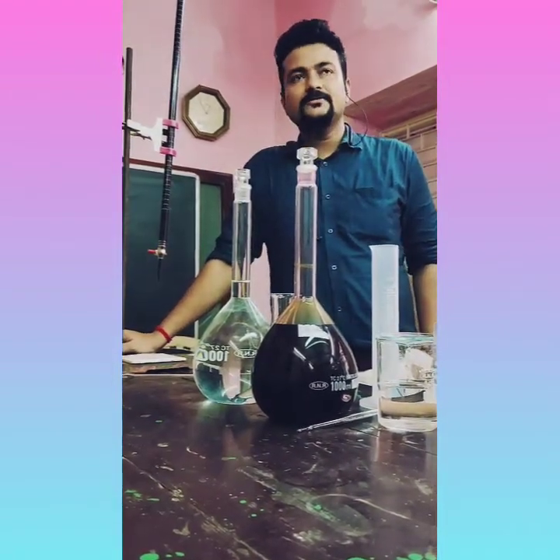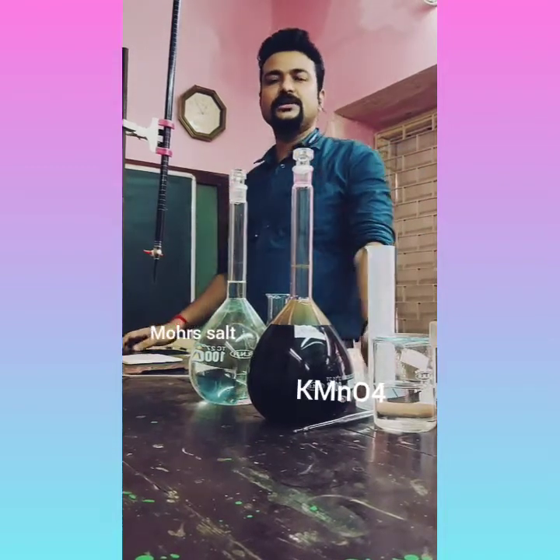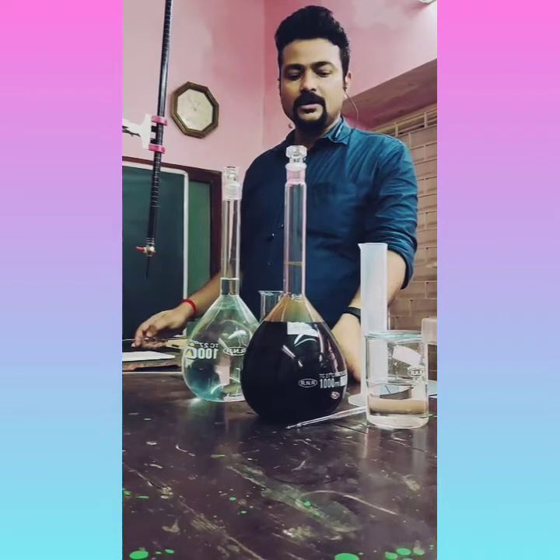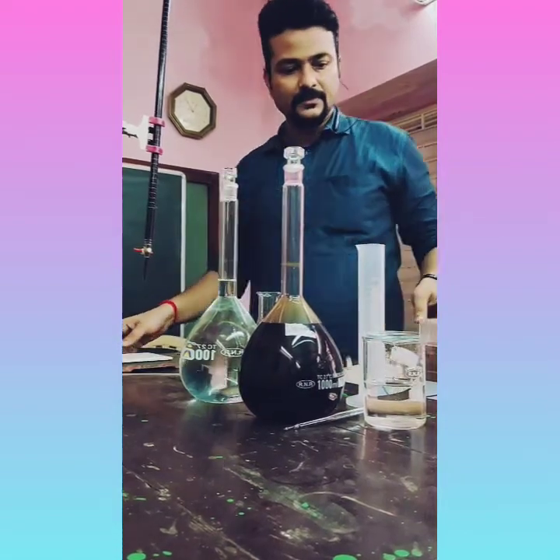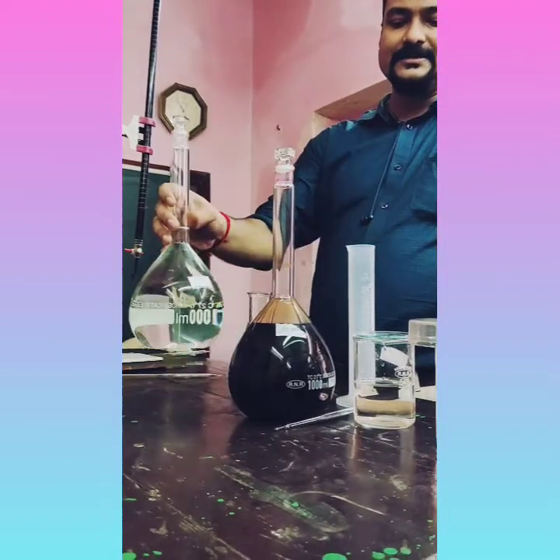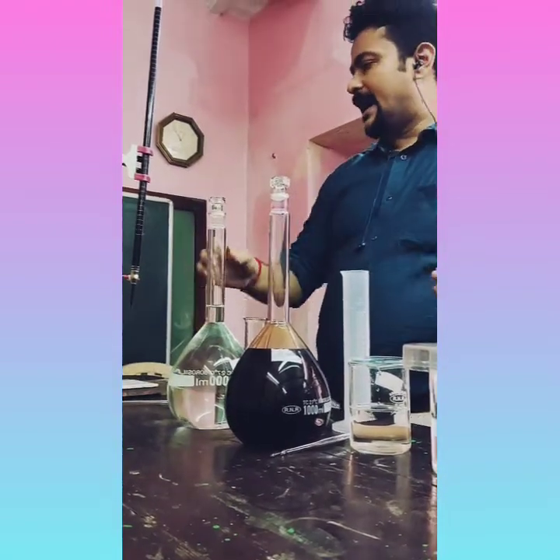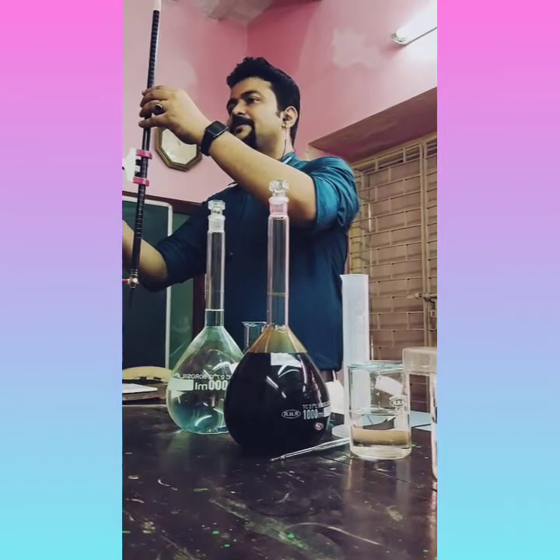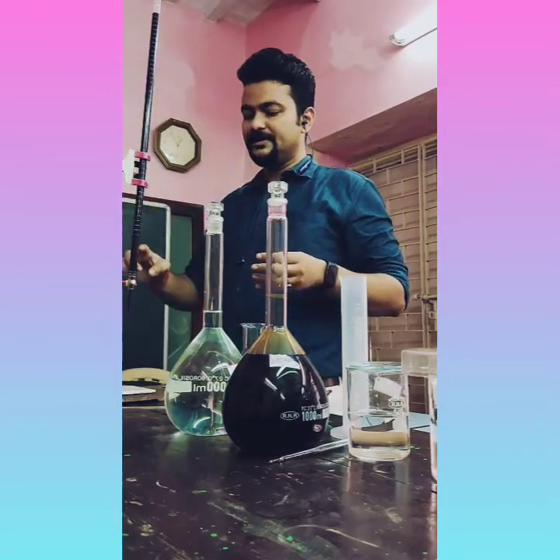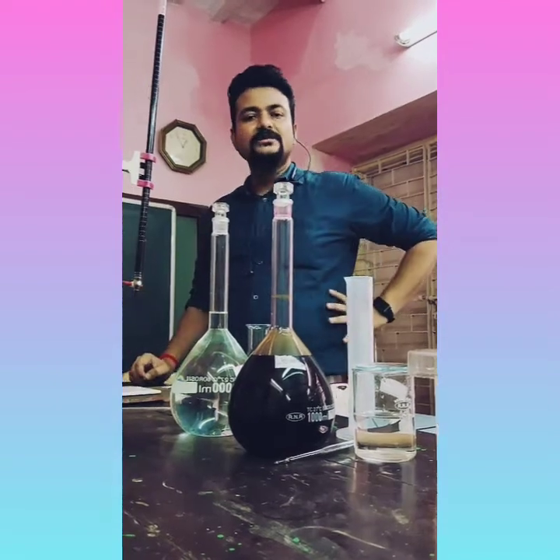One practical. The first practical is the titration between KMnO4 solution and Mohr's salt. You can see here, this is KMnO4 solution, which is pink in color, and this is Mohr's salt solution. We'll take the KMnO4 solution in this burette. You can see this is a total 50 ml burette. So today we'll start the titration.